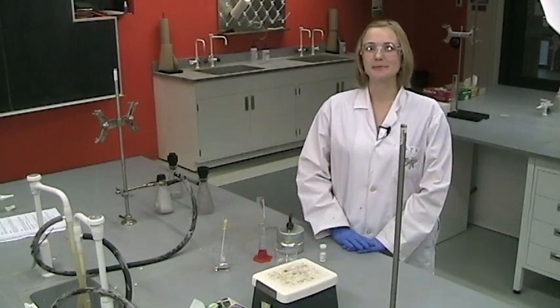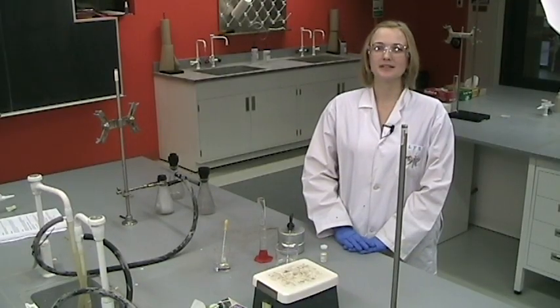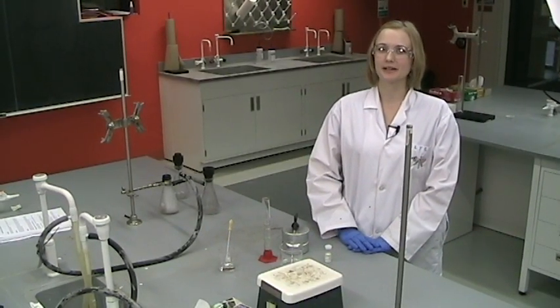Hi, my name is Elise. We'll be talking now about the experiment on gravimetric analysis of a chloride salt.